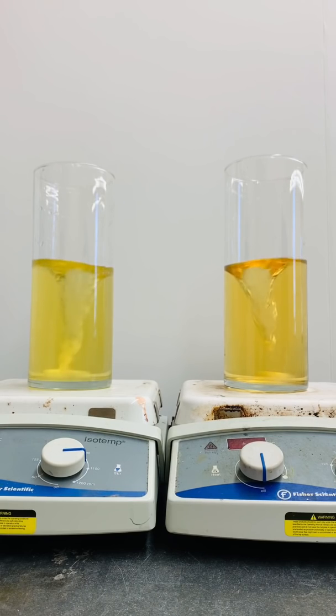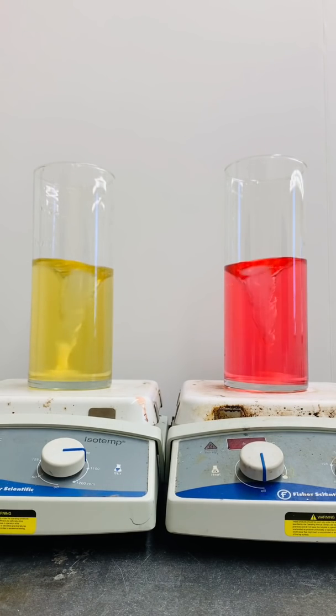Let's add some acid to both solutions to see what happens. When I add acid to the Alka-Seltzer solution, there's nothing going on. But wow, look at the red color when I add acid to the other solution. That's a huge color change.